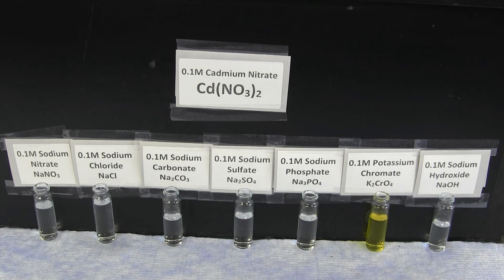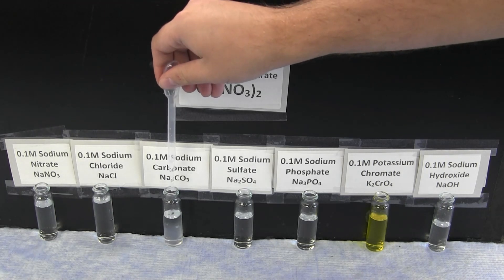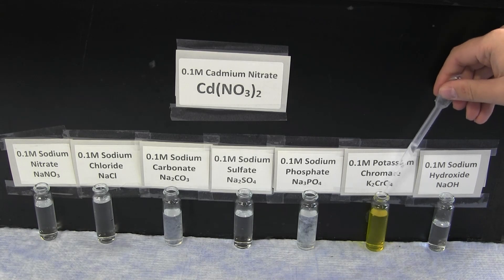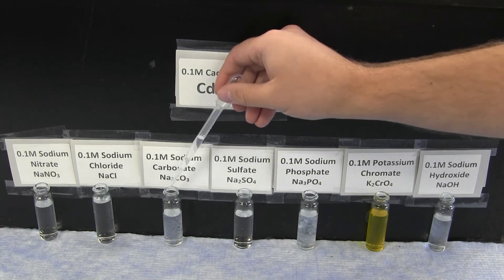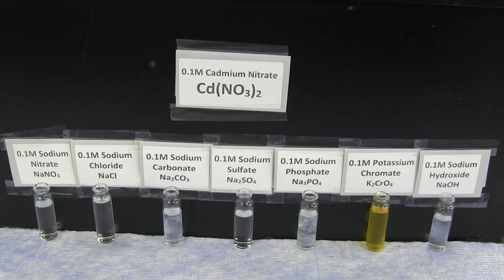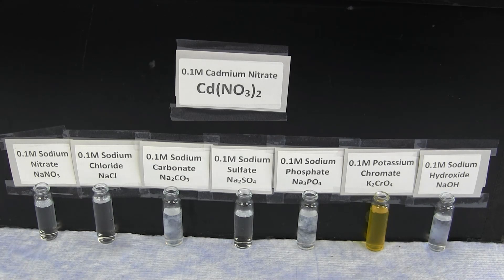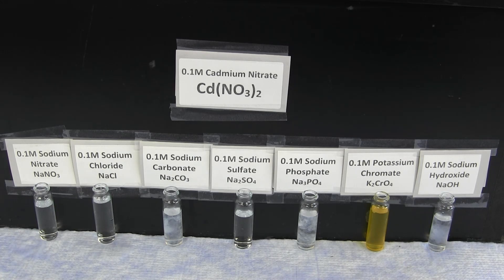The next ion to observe is the cadmium ion. Overall, the cadmium ion forms a white precipitate with sodium carbonate, sodium phosphate, and sodium hydroxide, and a very slight orange precipitate with potassium chromate. There is no reaction with sodium nitrate, sodium chloride, or sodium sulfate.